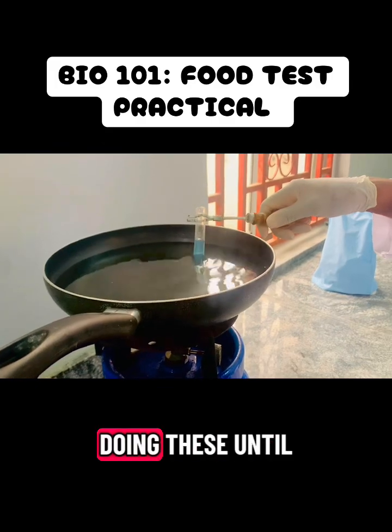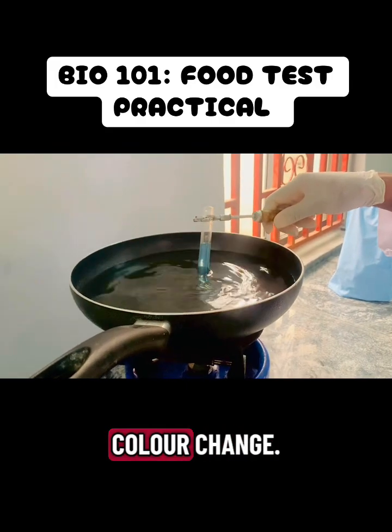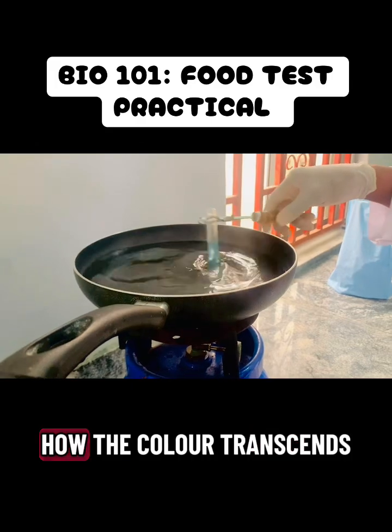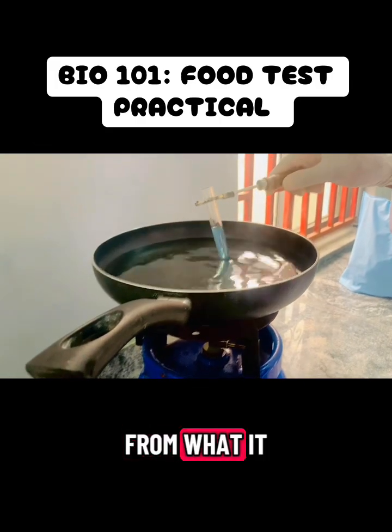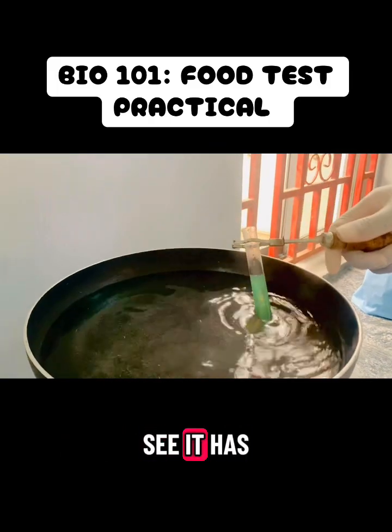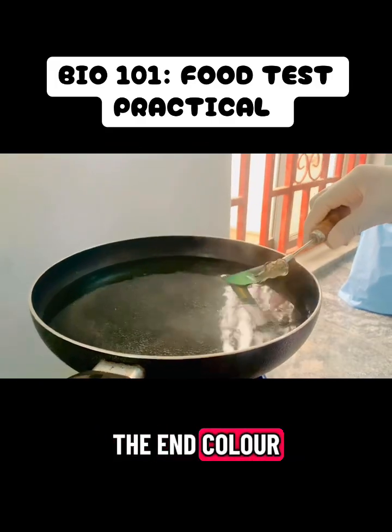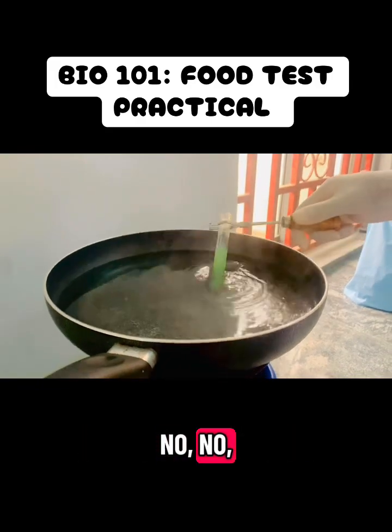We'll keep doing this until there is a color change. A color change indicates that glucose is present. Let's watch how the color transitions from what it is now to what we are expecting. You can see it has changed a bit, but this is not the end product. So we keep boiling. If you don't know what the end color is, you may want to pull out now. I just experienced it. No, we don't do that.